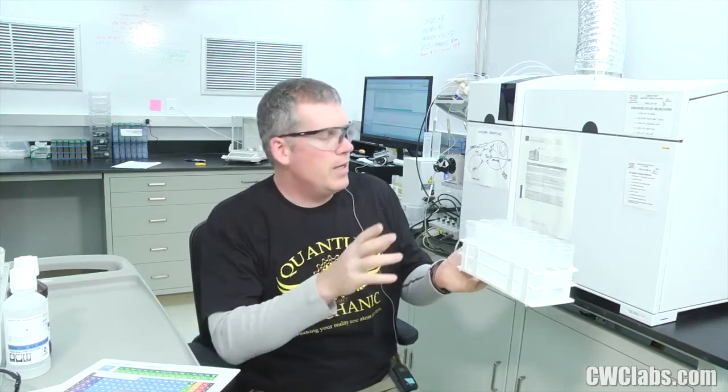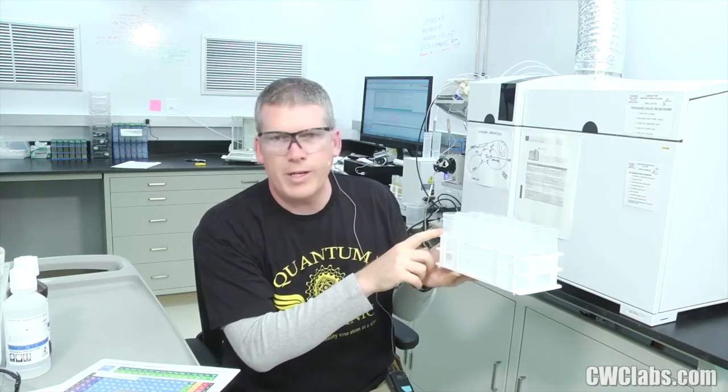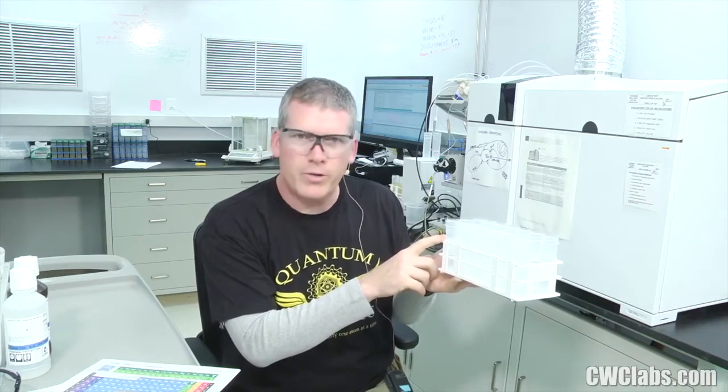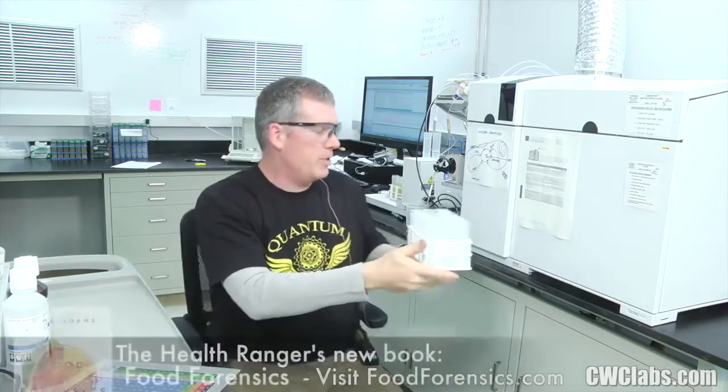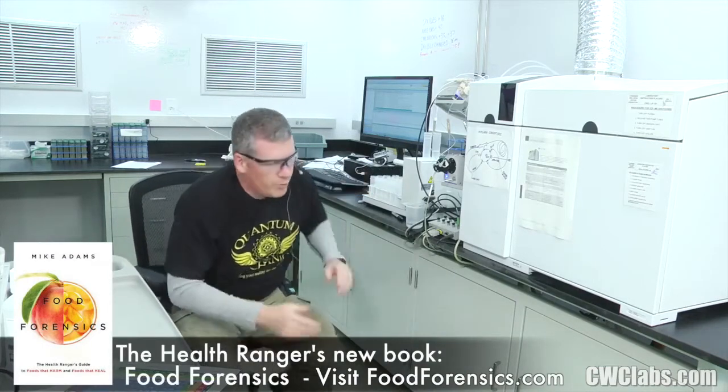The other thing that I like to do is I put a high acid matrix rinse here. I use 20% nitric and 2% hydrochloric in this vial, and I hit this vial before I do a background subtraction. If you look at background counts, when you first turn on the instrument and you get into your first vials, your background counts can be artificially high. And you need to hit the entire plumbing system with some very powerful acid in order to clean that system out before you take your backgrounds.